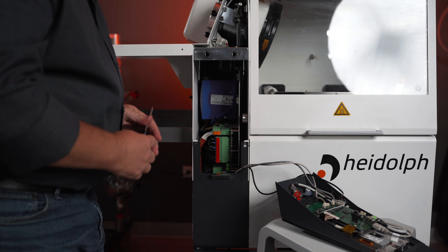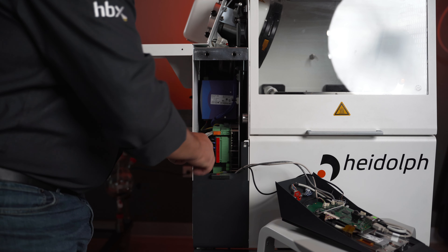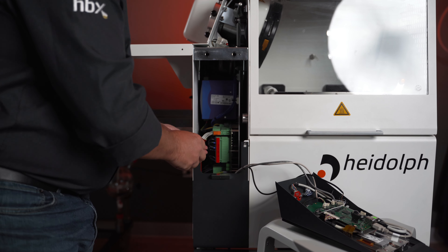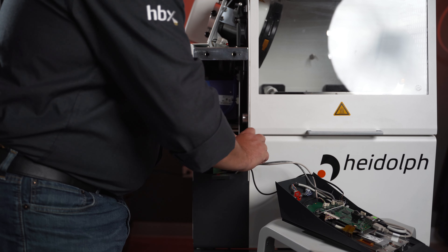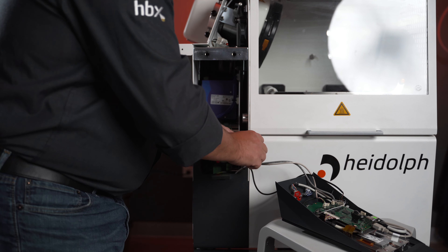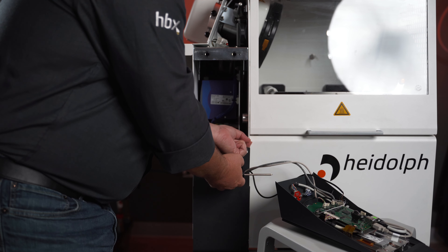Once you have your control panel removed, next we will remove the bottom blanking panel. On the older units you will have just a panel, and on the newer units you will have a power filter on the back of this panel. Sometimes this panel may just fall off; other times you may have to press down and then pull it off.